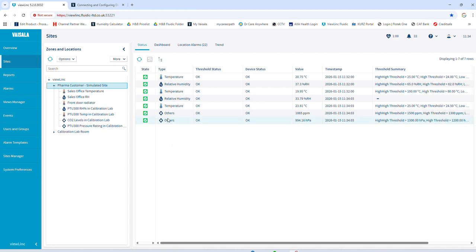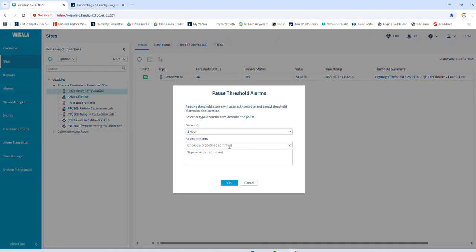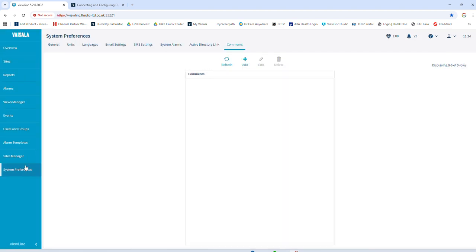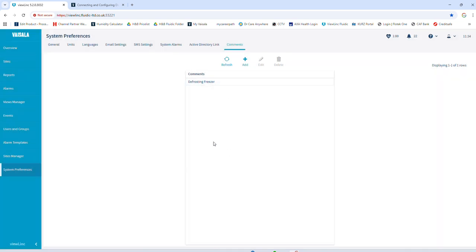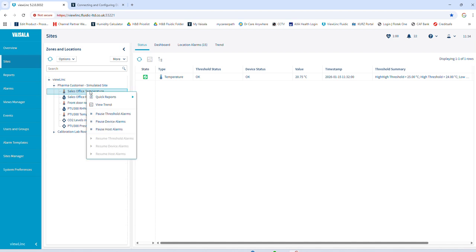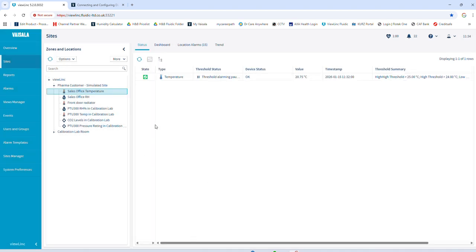Just to make life even easier again, I showed you this, pause threshold alarms. That comment is predefined, so you don't need to type in there. If I go back up here to system preferences, I've got comments. I can say defrost freezer. I can put in a list of comments that you'd want to have as standard. So when you do go back to sites, and I wanted to pause that for an hour, there we go. It's already done for you. Just to show again, that's it paused. That would unset after an hour. Let's set it, but we will resume. Easy peasy.